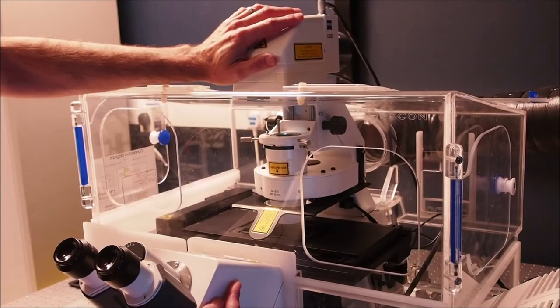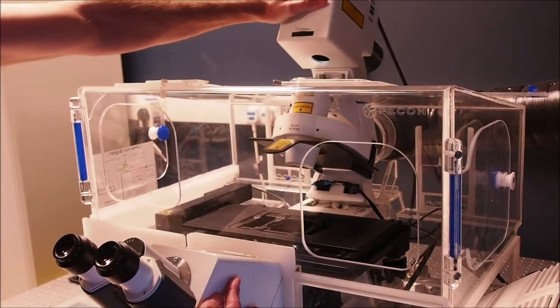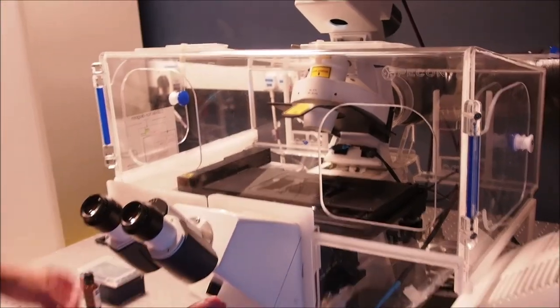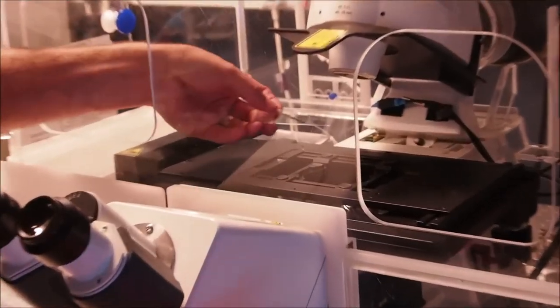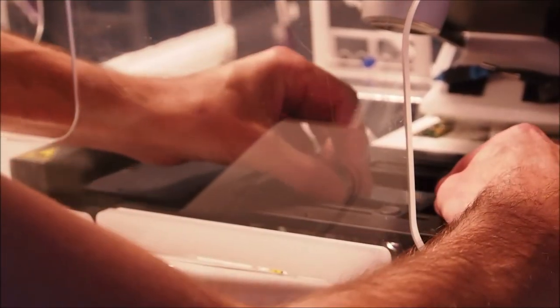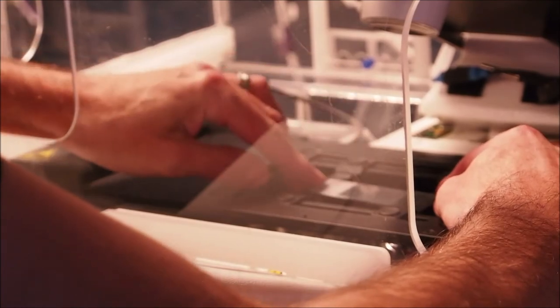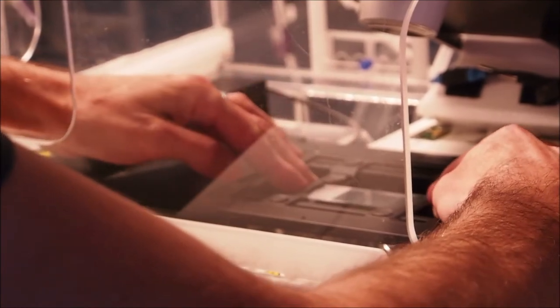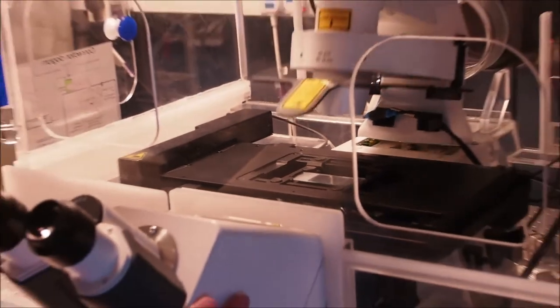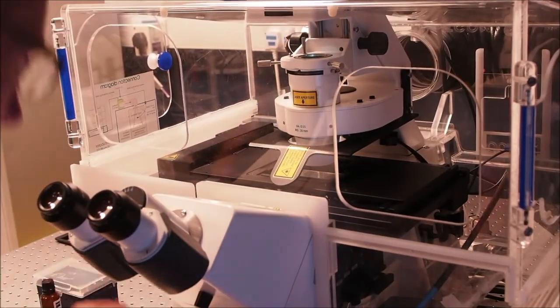To mount your sample, ensure the incubator top cover is opened and tilt the condenser arm back. Bring your sample in through one of the front incubator doors and mount on the stage, coverslip downwards, and push the holder together to hold your sample. Bring the condenser arm forward and focus your sample.